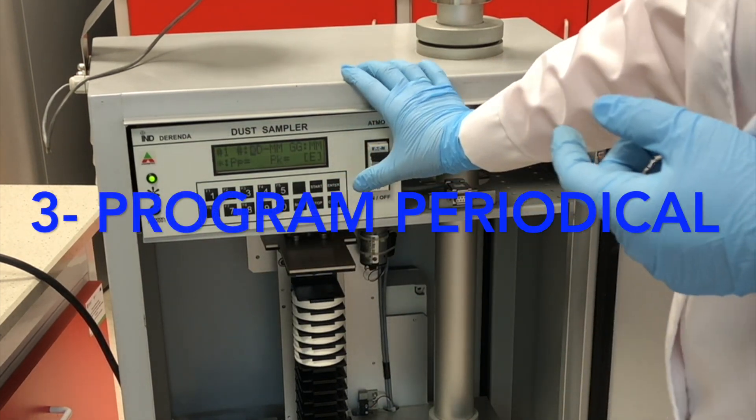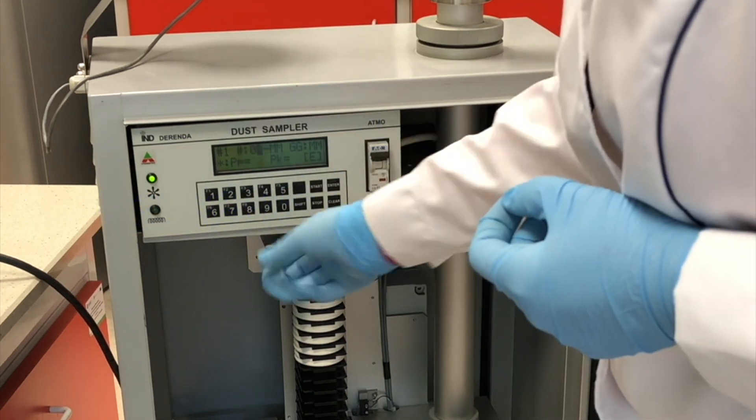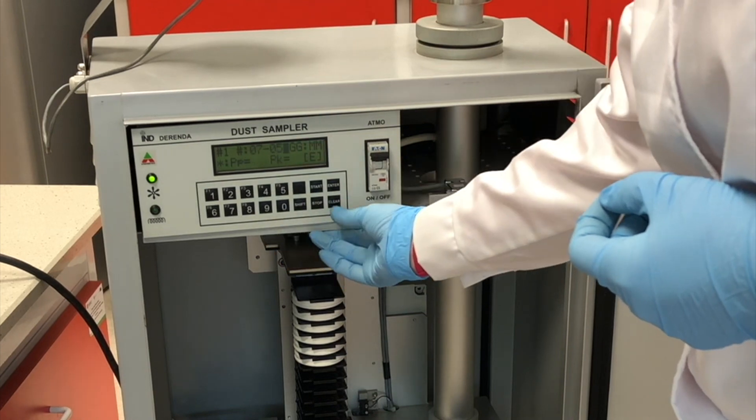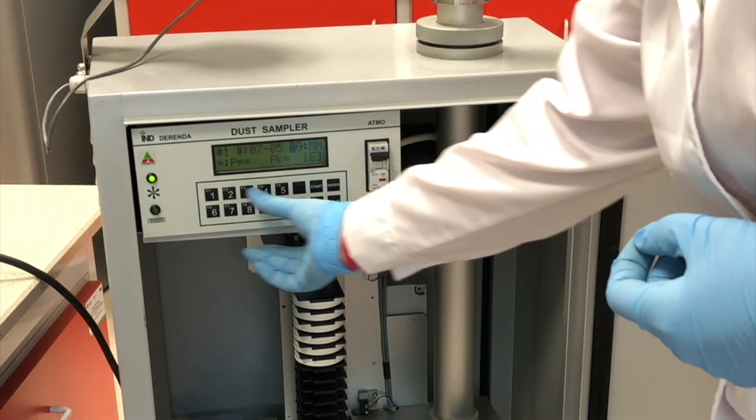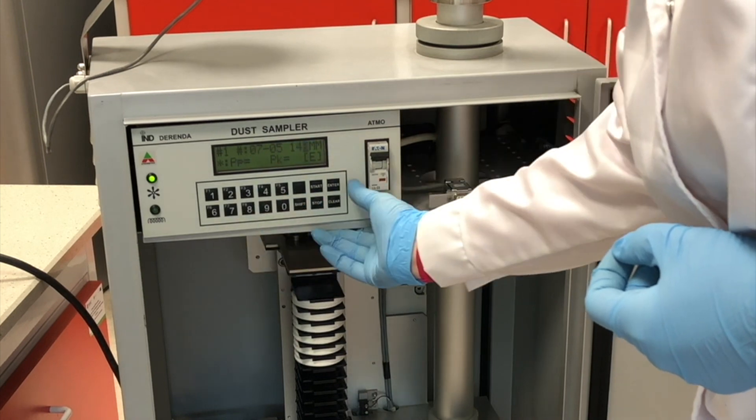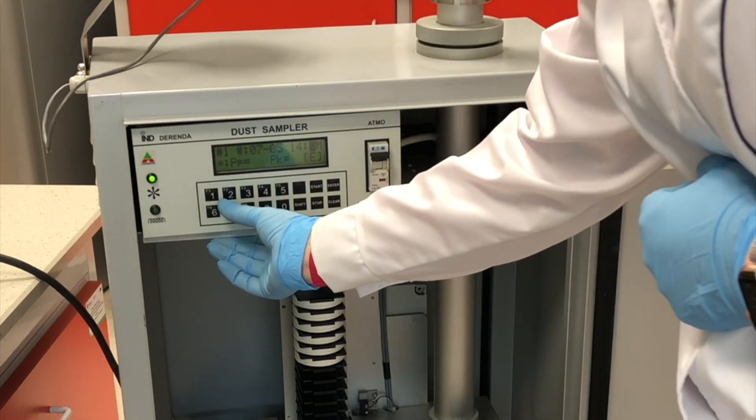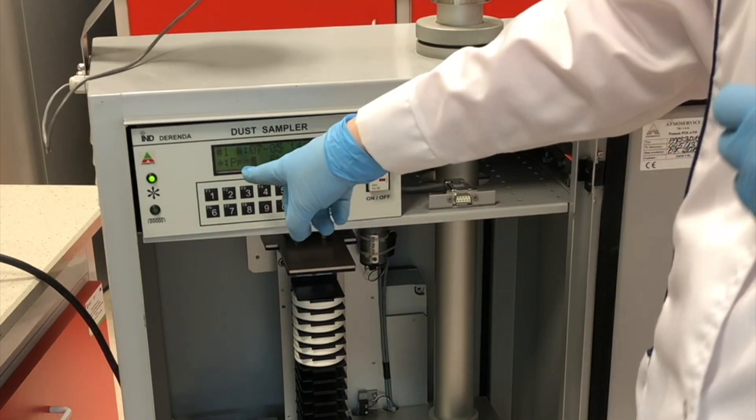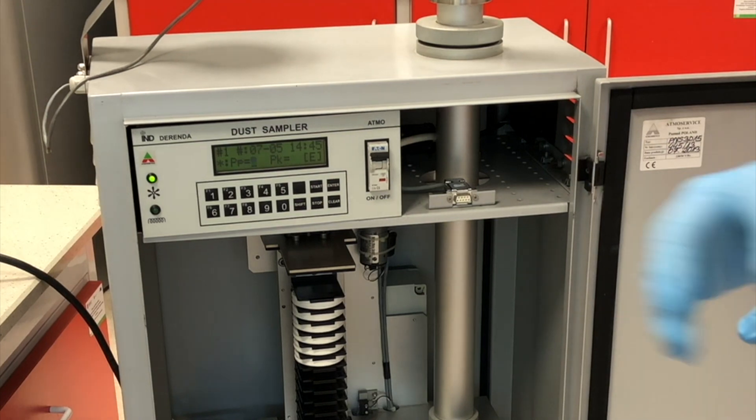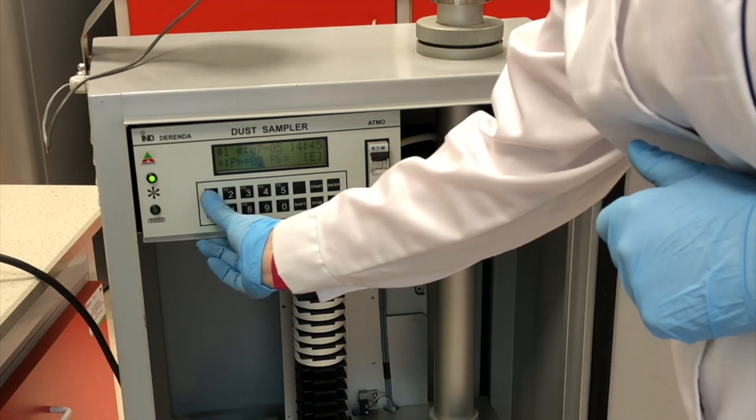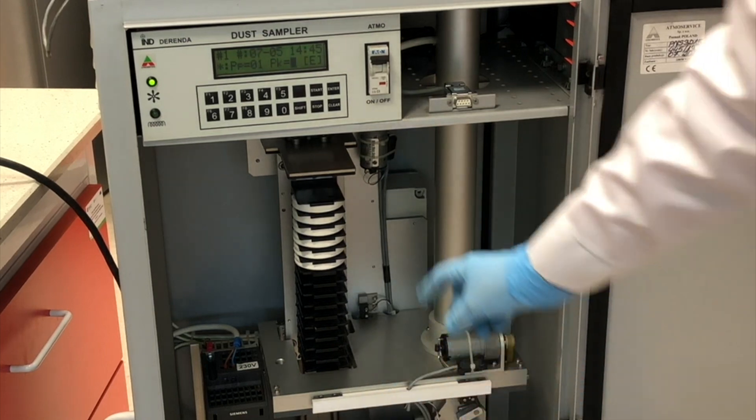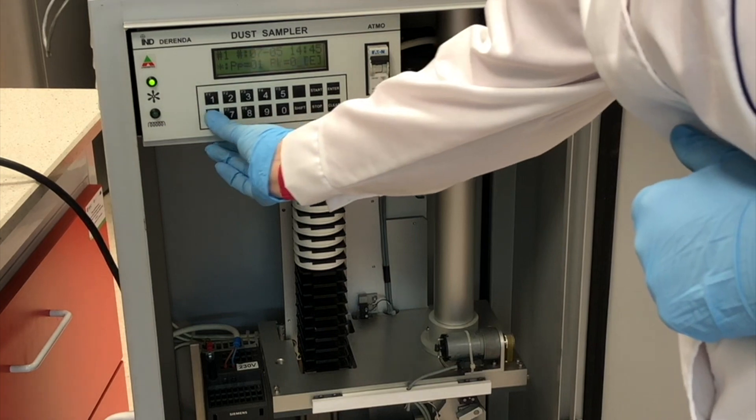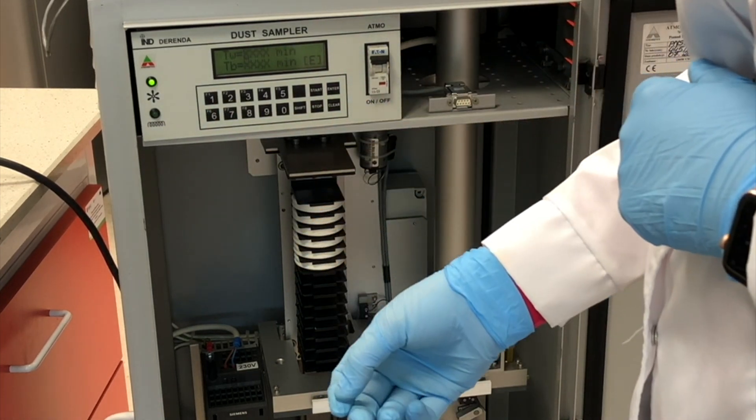We have to press ENTER and here we have to put the date. It will turn on in a few minutes. We have to put the filter which will start. The first filter is our filter to start. And we have 1, 2, 3, 4, 5, 6 filters. So 0, 6 is the last one.